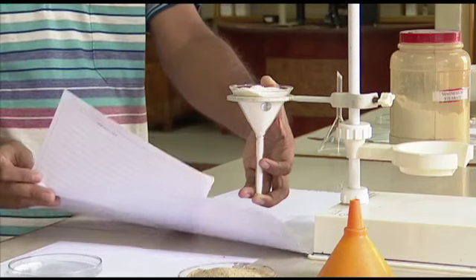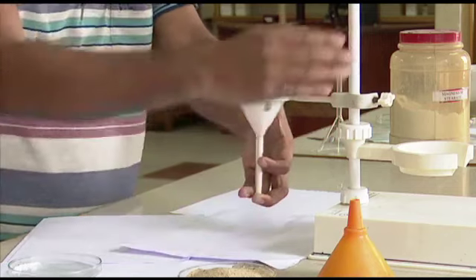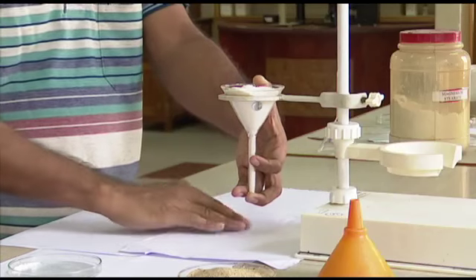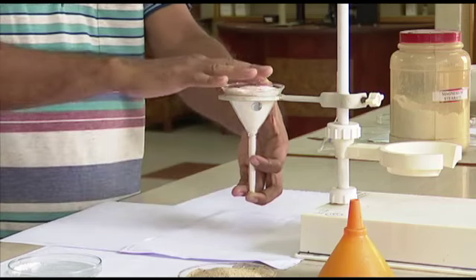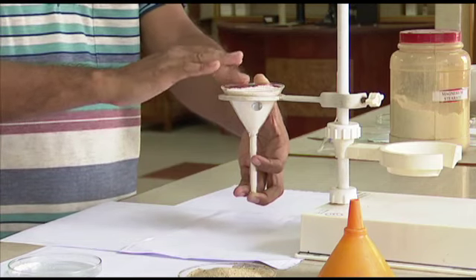So in our case, we will be using the same funnel and we will be using different materials. So the conditions are same, and the funnels will be filled to the same level, so that the heap, if the flow is same, should ideally be equal, but it won't be. It won't be because the materials are not same, sorry.